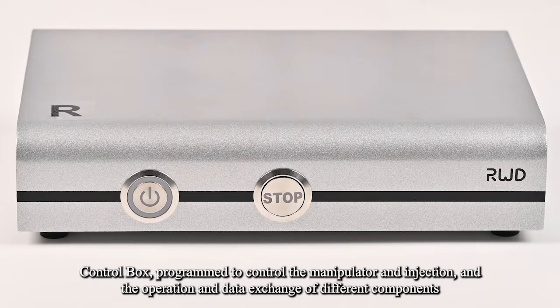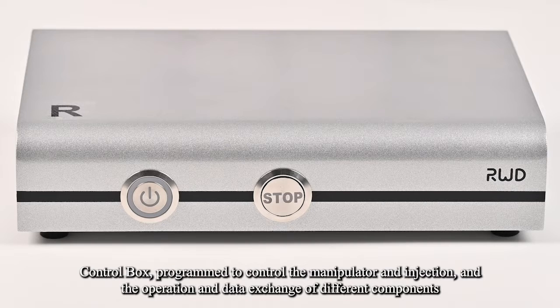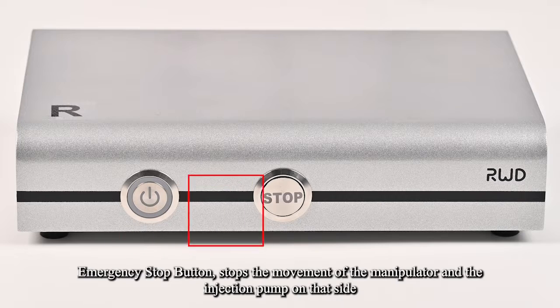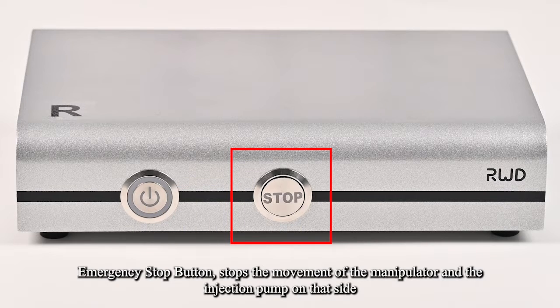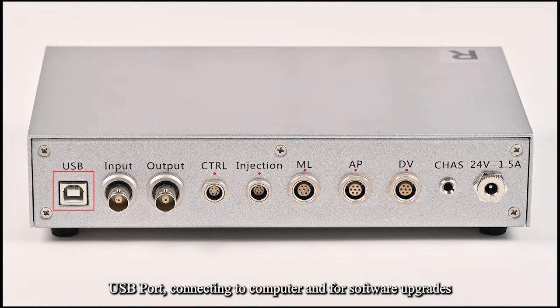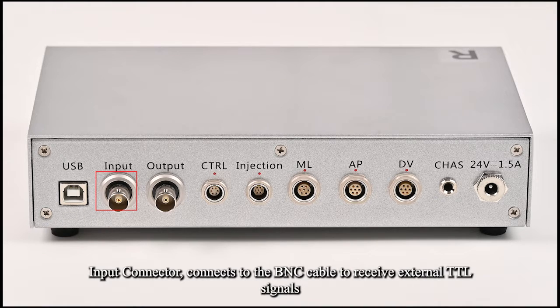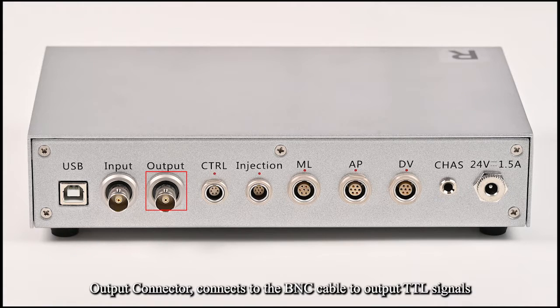The control box is programmed to control the manipulator and injection, and handles the operation and data exchange of different components. The control box power switch turns the control box on or off. The emergency stop button stops the movement of the manipulator and the injection pump on that side. The USB port connects to the computer and is used for software upgrades. The input connector connects to the BNC cable to receive external TTL signals, and the output connector connects to the BNC cable to output TTL signals.